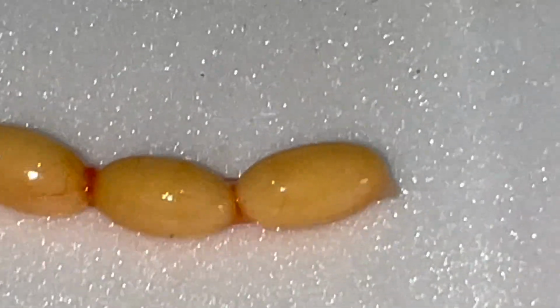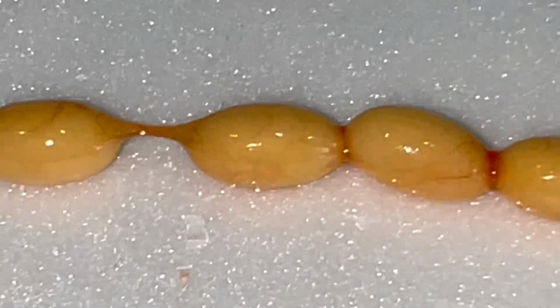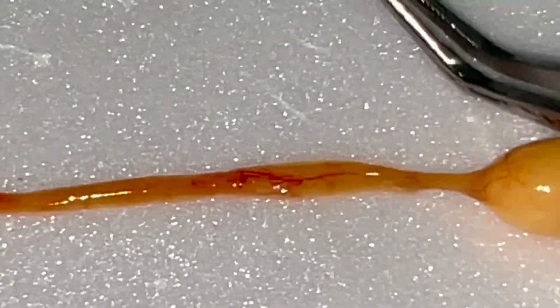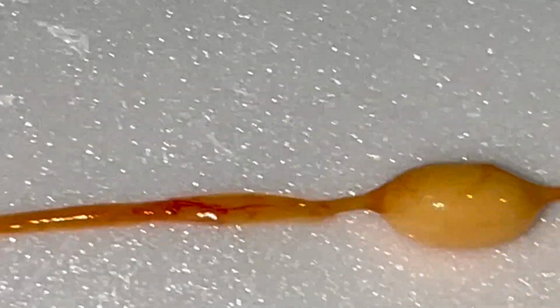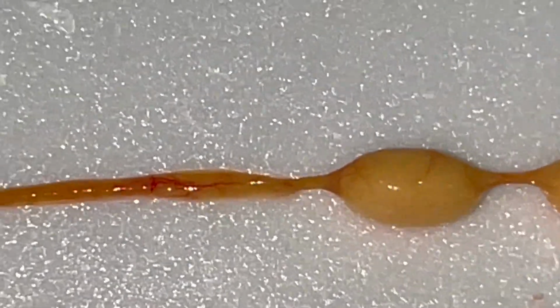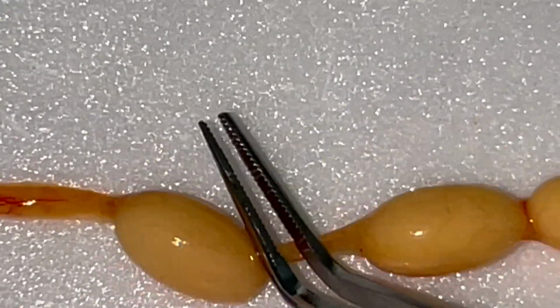Now when we are studying the chameleon's anatomy, you can see that these are the eggs in the oviducts, and the oviduct is actually a very tiny structure, a tiny tube that carries the eggs and serves their nutrition, and the eggs can of course be moved through it.